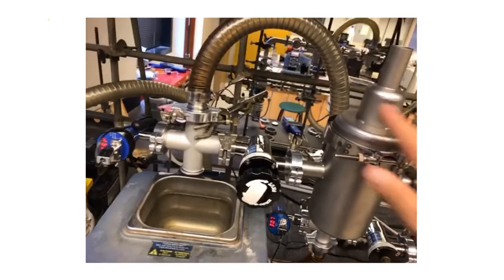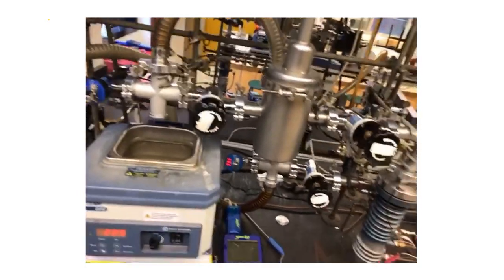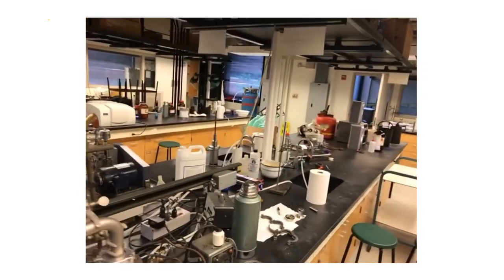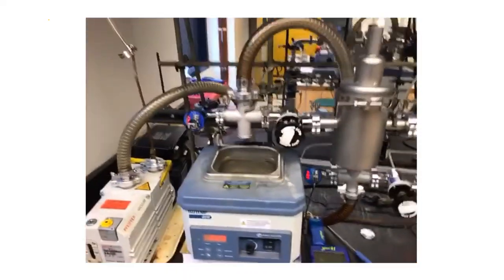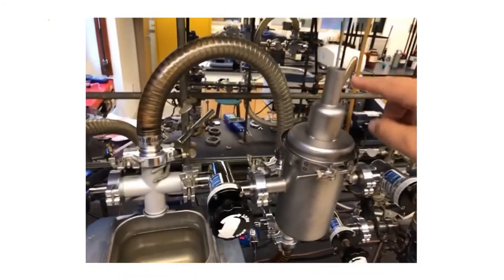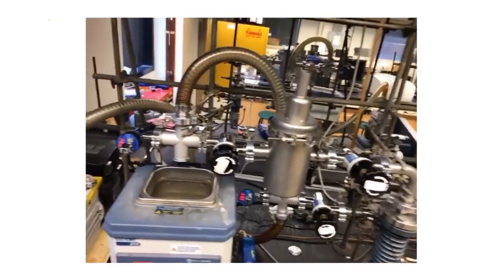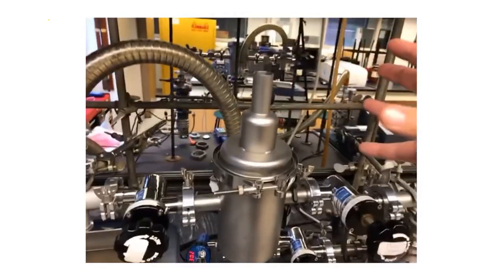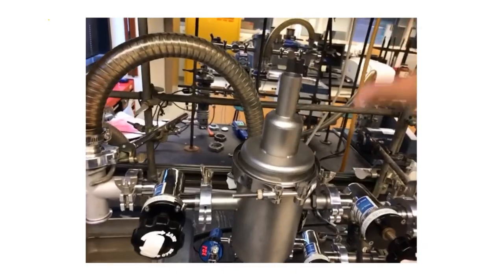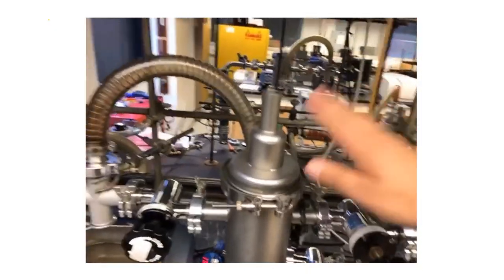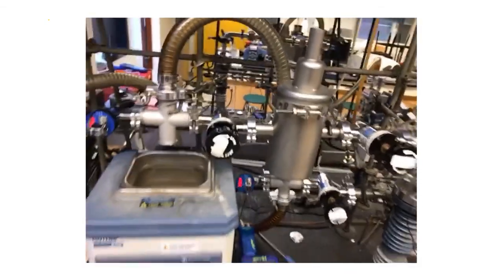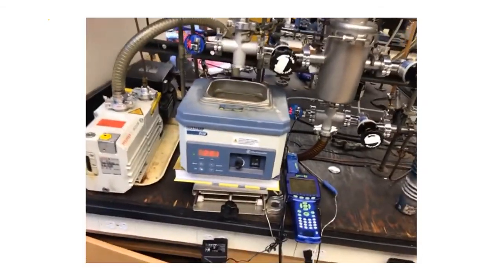The other thing that we can do while we're getting ready to set the experiment up is fill our trap with liquid nitrogen. We'll get liquid nitrogen—there's that big blue tank if you can see it in the back of the lab. We'll get liquid nitrogen over there and then fill in here until this is full. Sometimes it's hard to tell what's going to happen. You have liquid nitrogen, really cold—it's going to boil and be kind of reactive at first. You're just going to see the boiling of nitrogen. Eventually you can get this whole trap completely filled, and then we'll have our sample here in our water bath.